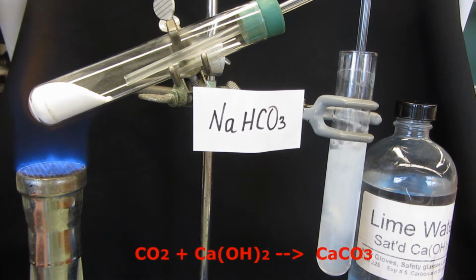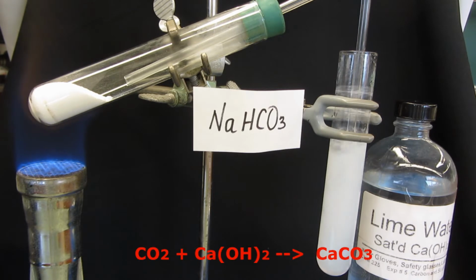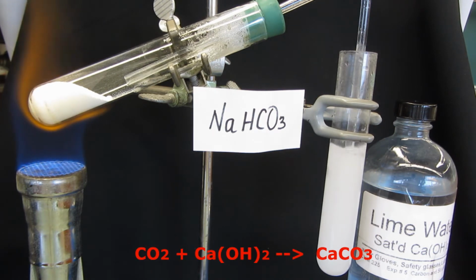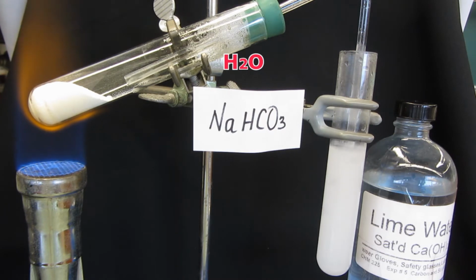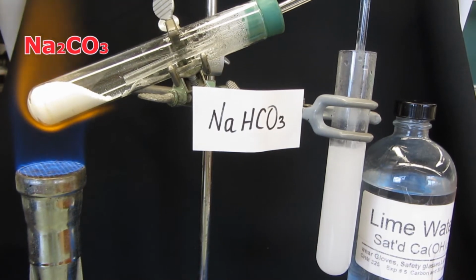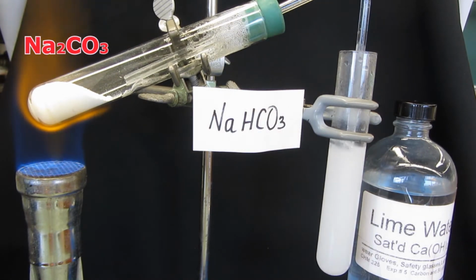Now, carbon dioxide reacts chemically with calcium hydroxide, precipitating calcium carbonate, CaCO3. Calcium carbonate is essentially limestone, and it's insoluble in water. And after some time, you can also see the buildup of water condensing in the top of the test tube on the left. And so we see that the decomposition of a metal bicarbonate releases carbon dioxide gas and water. And what's left in the test tube on the left, that white solid, is no longer going to be sodium bicarbonate, but will be a metal carbonate, in this case, sodium carbonate, Na2CO3.